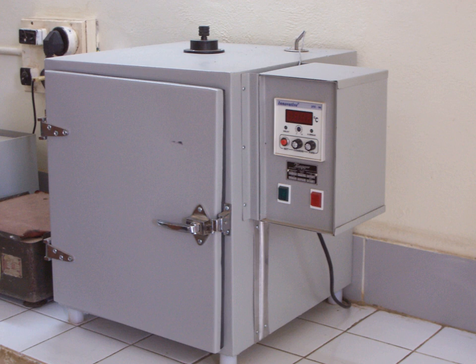Incubators serve a variety of functions in a scientific lab. Incubators generally maintain a constant temperature; however, additional features are often built in. Many incubators also control humidity. Shaking incubators incorporate movement to mix cultures. Gas incubators regulate the internal gas composition. Some incubators have a means of circulating the air inside to ensure even distribution of temperatures. Many incubators built for laboratory use have a redundant power source, to ensure that power outages do not disrupt experiments.